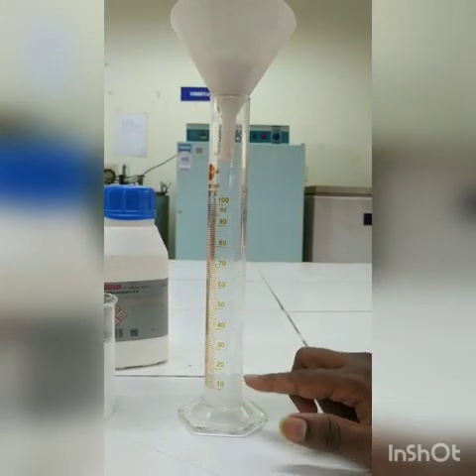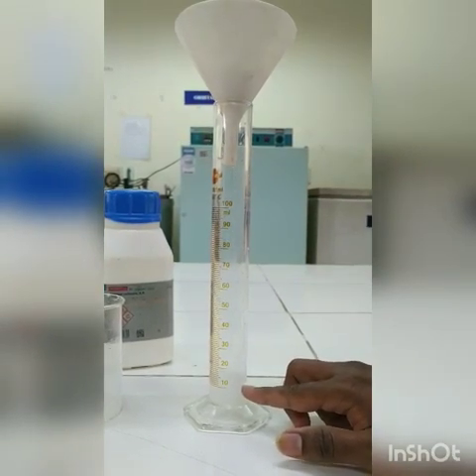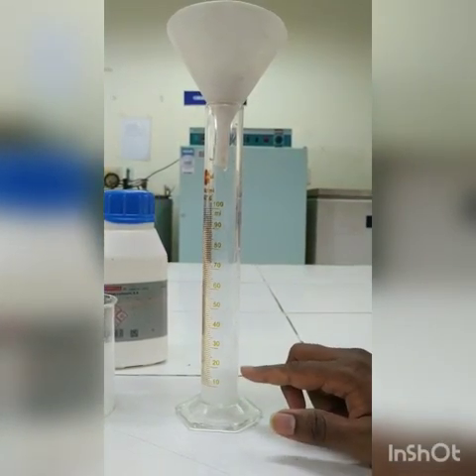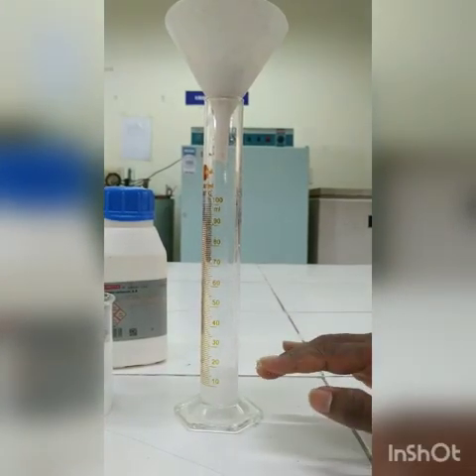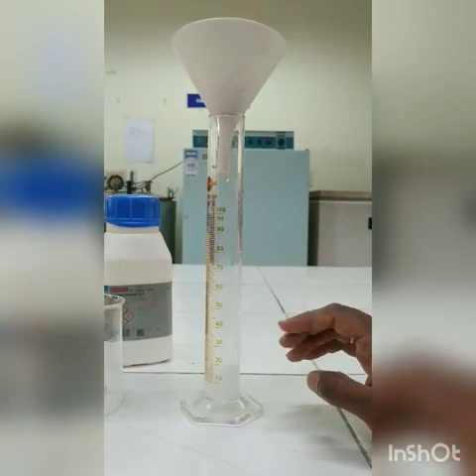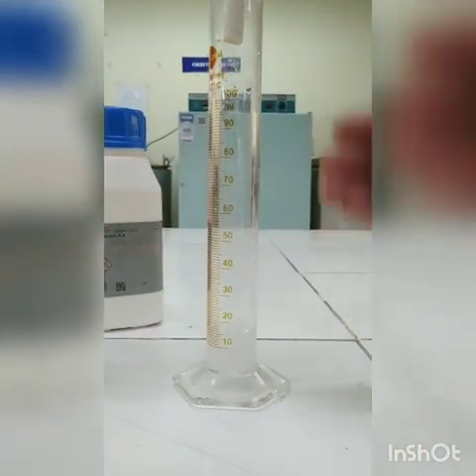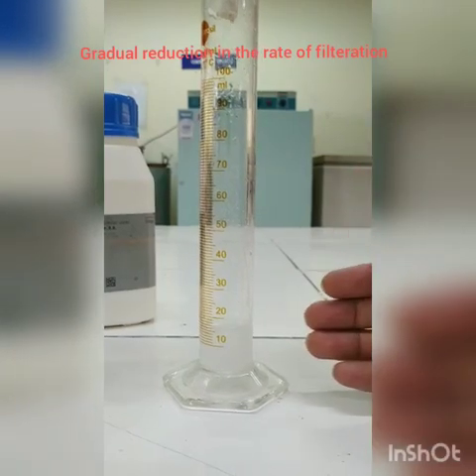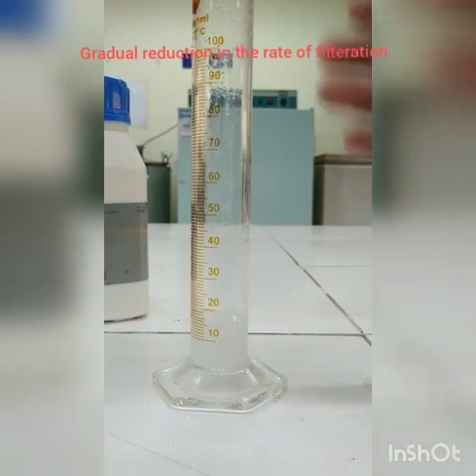Say for example, start measuring the volume of filtrate from 30 seconds. So at 30 seconds measure 10 ml, and then after 60 seconds measure the volume of the filtrate. Likewise, we need to go on. You can see initially the filtrate collection is very fast. The drop is very fast. Now it has started to reduce.